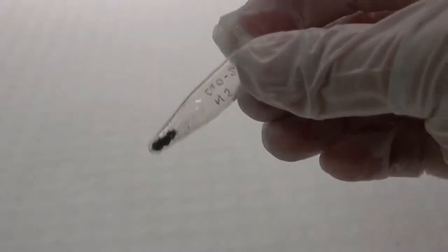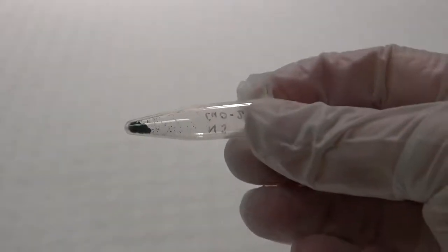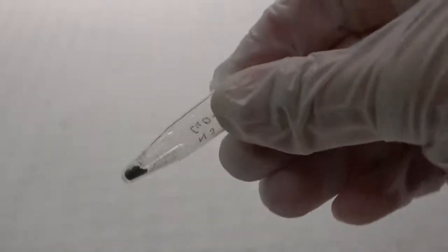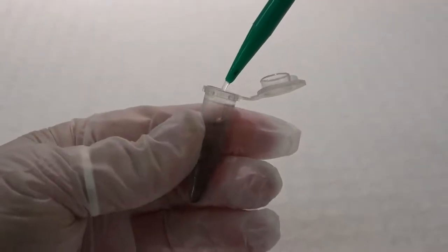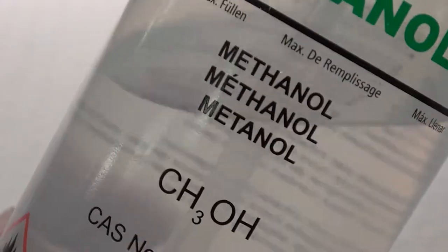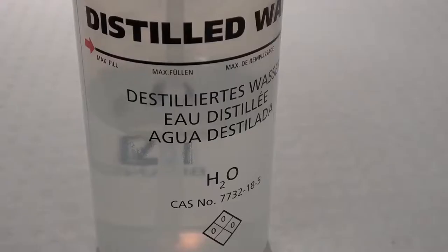Materials: For this procedure, you will need a very small amount of the sample in dry particulate form or in solution. A tenth of a gram of dry sample is more than enough. You will also need a solvent in which to suspend the particles. Common solvents include methanol, ethanol, or water.